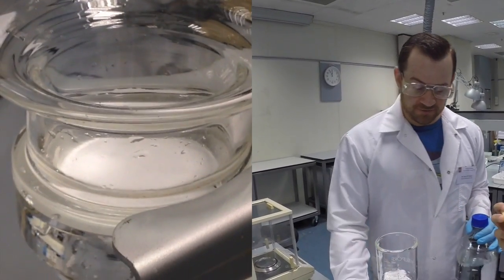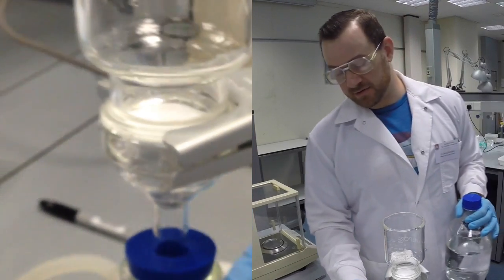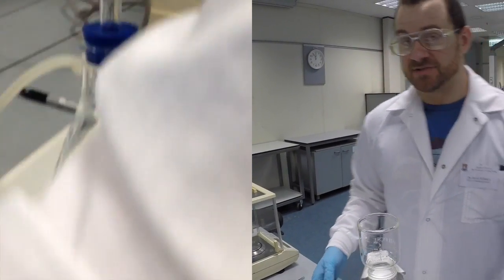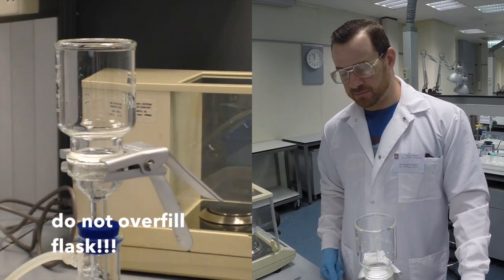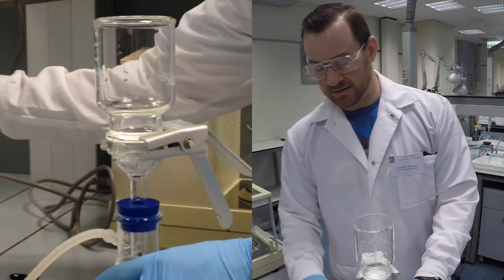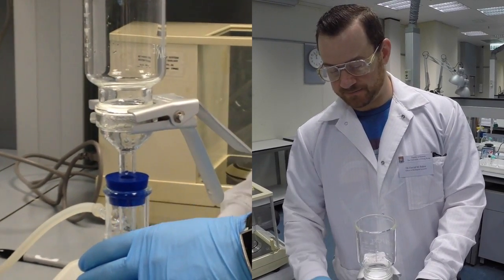You want to be sure that if you're filtering a lot of liquid, that you do not exceed the level of the sidearm, otherwise you'll risk introducing liquids into our vacuum line, which will be a very expensive problem here in the School of Biological Sciences. So please turn off the vacuum and disconnect the tube if you need to empty the volume of this container.